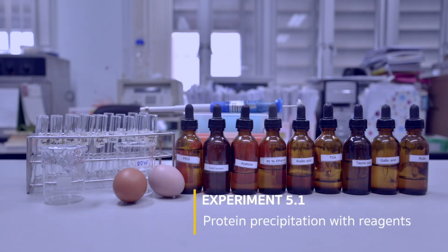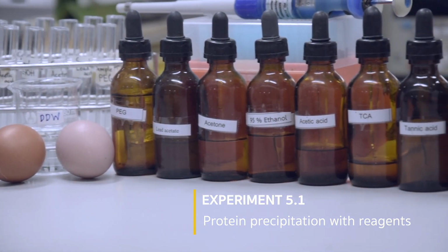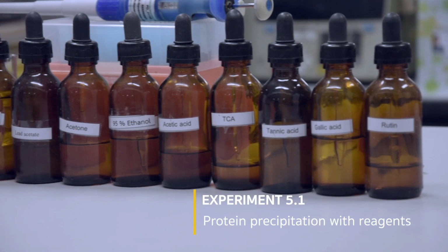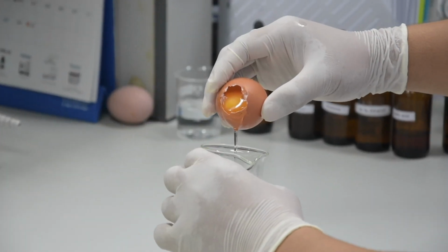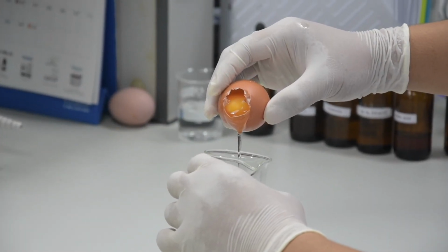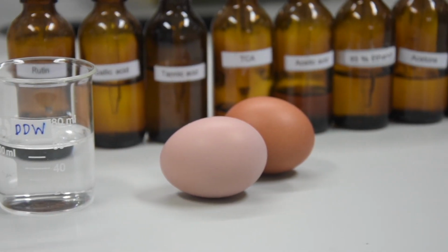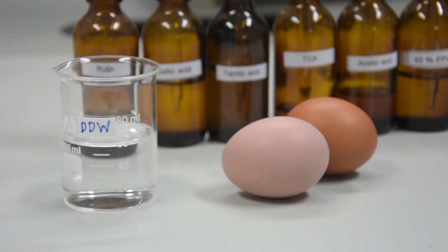Experiment 5.1: Protein precipitation with reagents. In this experiment, we will study the precipitation of protein in egg white by using several reagents and investigate the effects of each reagent.